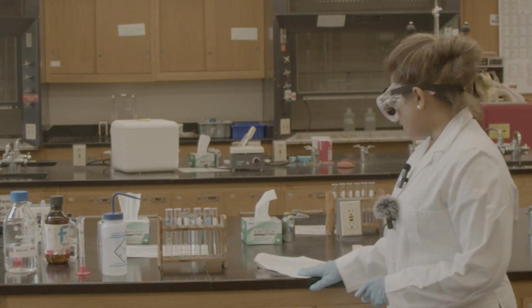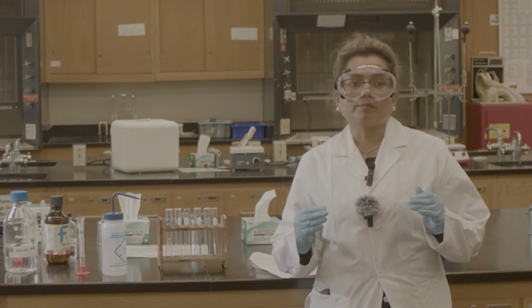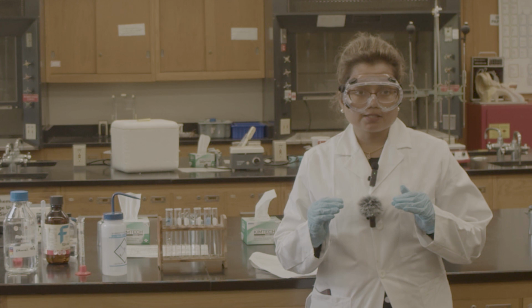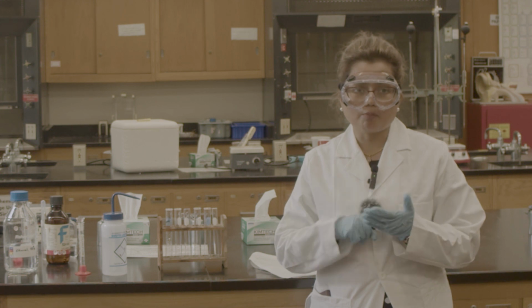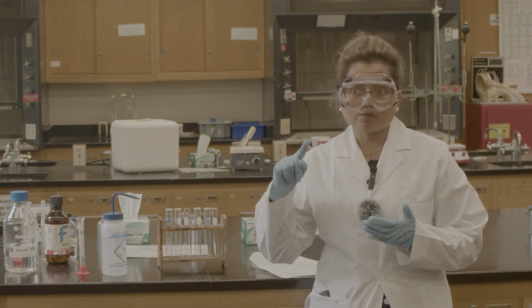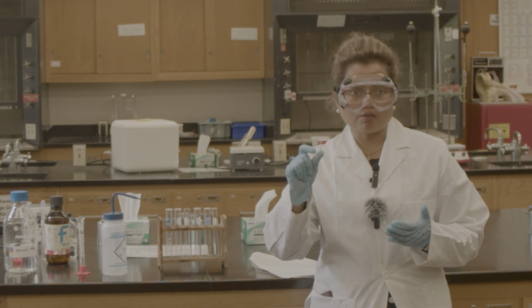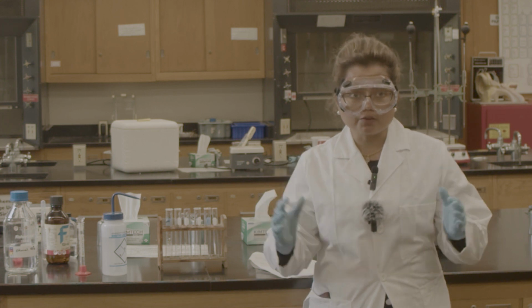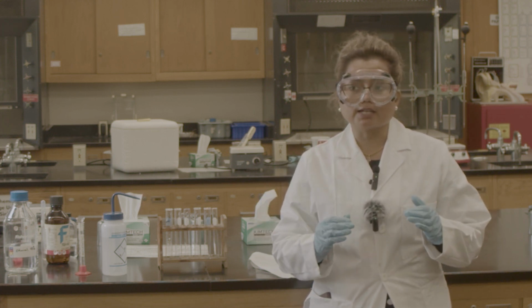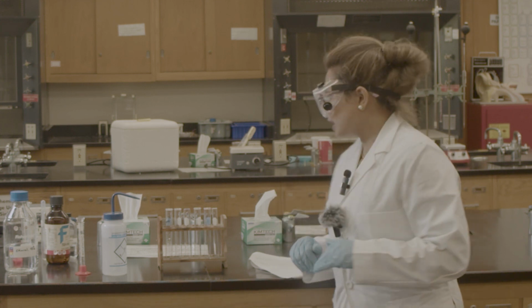Now in group 4, what we are doing is different types of liquids. We are trying to see if they mix, that means whether you see any layer or not. This is the point of this experiment. In group 3, we tried to dissolve a solid in different types of solvents, polar and non-polar. In group 4, we are trying different polar and non-polar liquids to see if they are homogeneous or heterogeneous. Homogeneous means we cannot see any layer, but in heterogeneous, we can see the layer. That's what we are doing in the experiment.